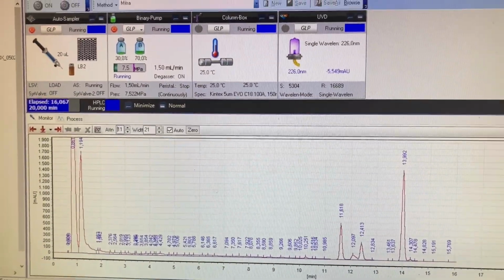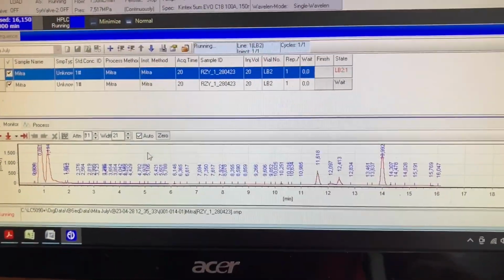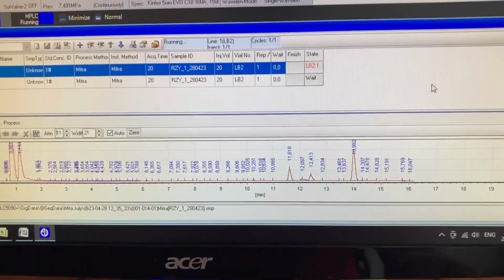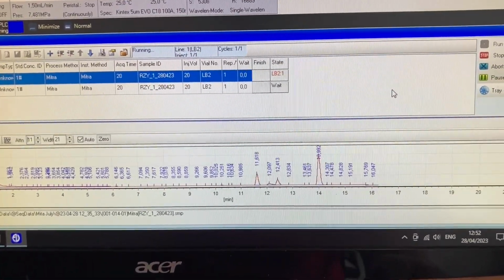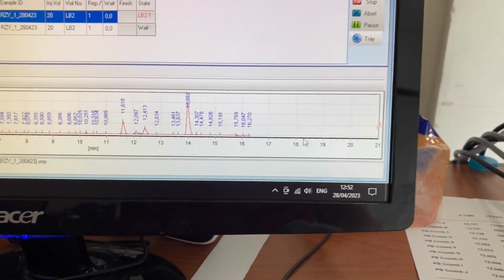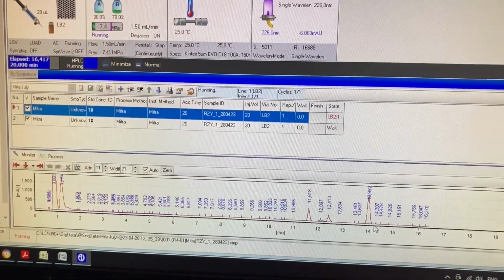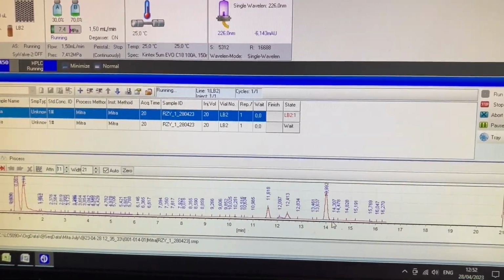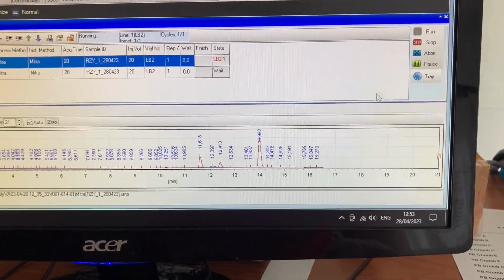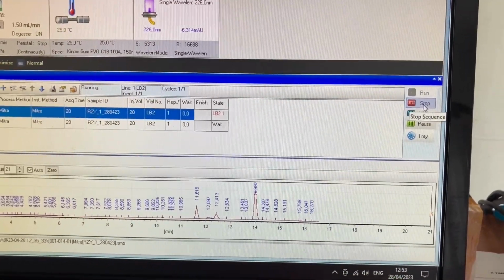This is only actually the initial run. So I'll come over here, I'll bring up the sequence. You can see it's still doing the initial run. But before that finishes, because I've already found the peak, it's going to run for 20 minutes. I don't really need it to, because this is just a trial run anyway to see if the ferrule blows out. So before it finishes, I'll stop it. But usually you just do the complete run.